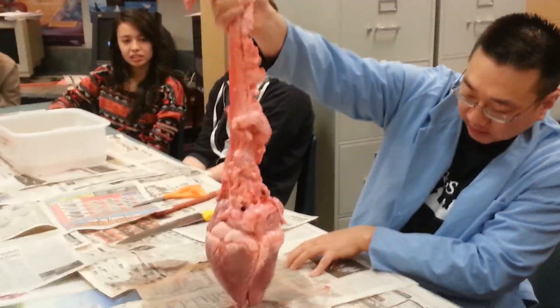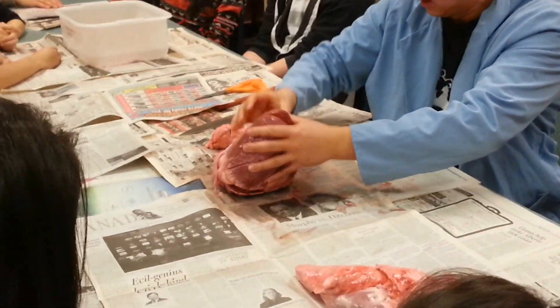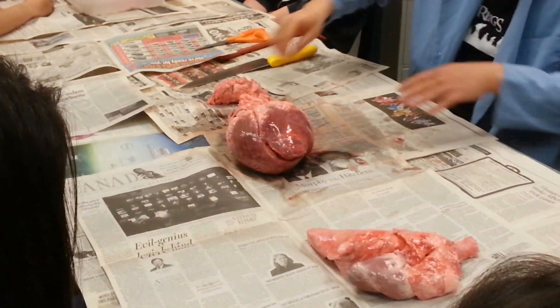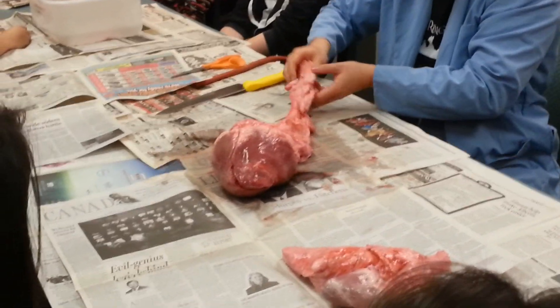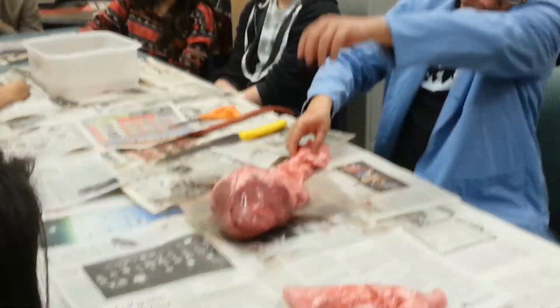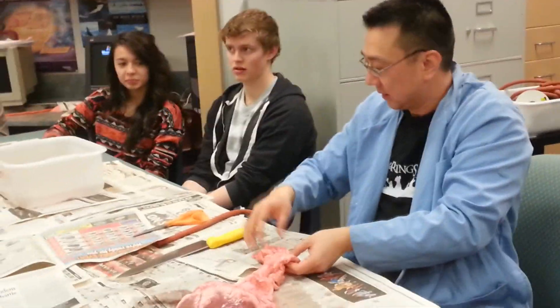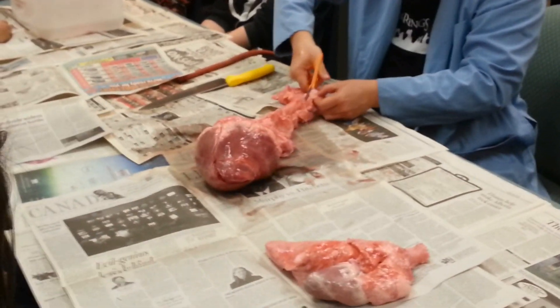Let me take a minute here and clean it up a bit. Okay, this one — I guess the inspector did open it to have a look. So, does the entire thing go up with air? Like the lung part? All through the air... You and Shay were tapping and we thought it was hollow. But it's actually — yes, those are air sacs in there. They're just microscopic. Okay, let me clean this aorta up a little bit so you can see. This is all fat.